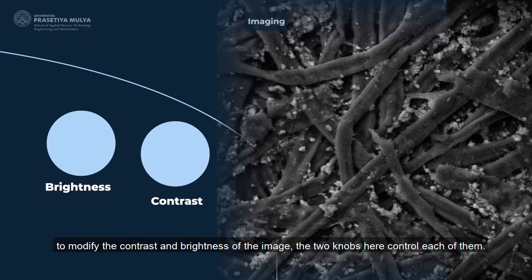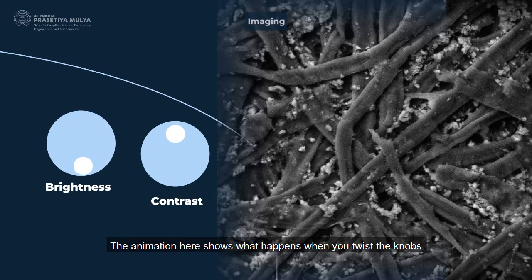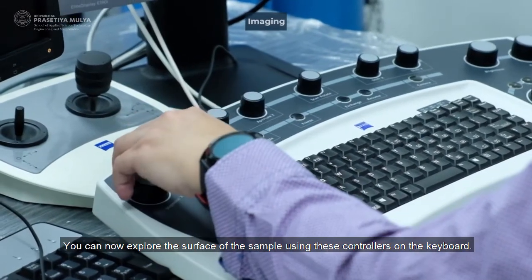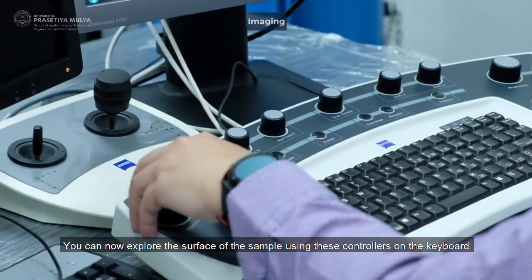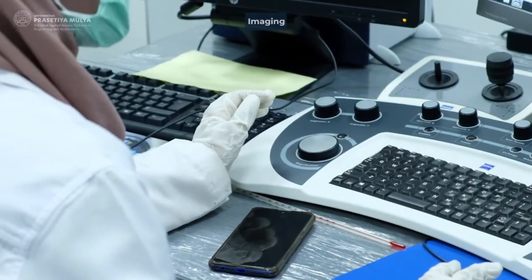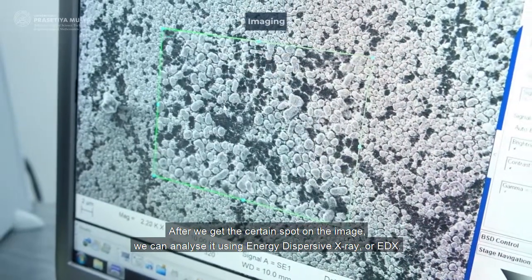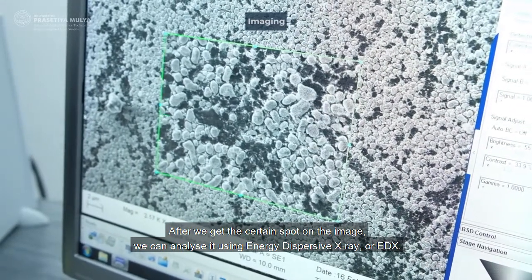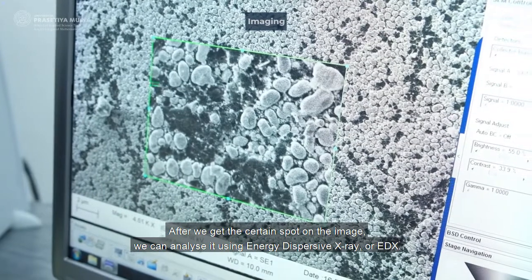To modify the contrast and brightness of the image, the two knobs here control each of them. The animation here shows what happens when you twist the knobs. You can now explore the surface of the sample using these controllers on the keyboard. After we get the certain spot on the image, we can analyze it using Energy Dispersive X-ray or EDX.